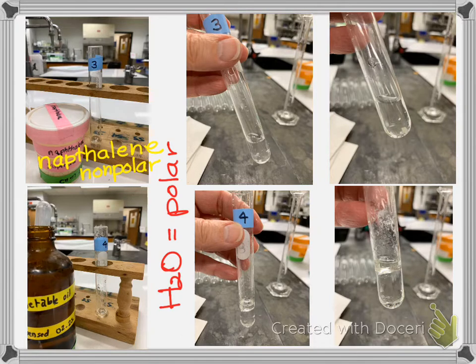Okay, so let's think about this ahead of time before we look at our results. Nonpolar and polar. Those are not alike, and the rule is like dissolves like. So we would expect naphthalene not to dissolve in water. And so here it is far away, and then there it is. And if you look carefully on the bottom of the test tube, there are flakes of naphthalene. They did not dissolve. And I used a stirring rod, I tried to grind them up. They would not dissolve. So we would say this is insoluble. Or in the directions it said I could just write the letter I.